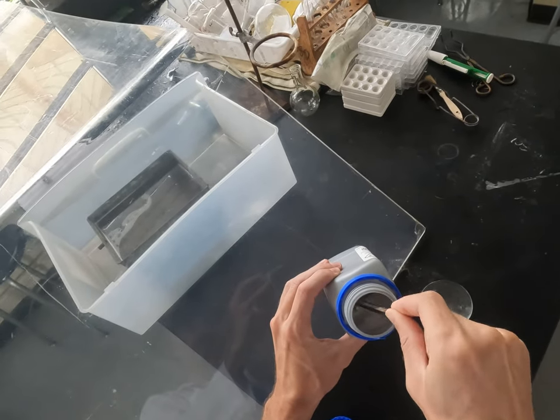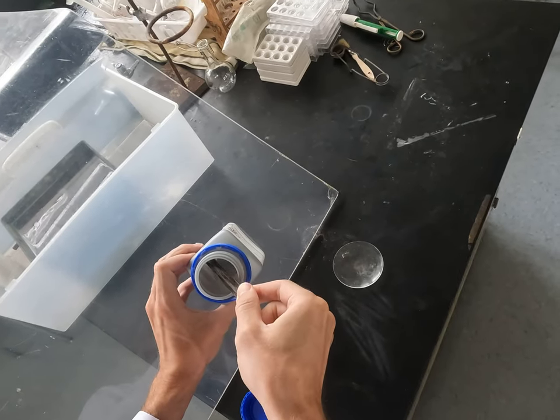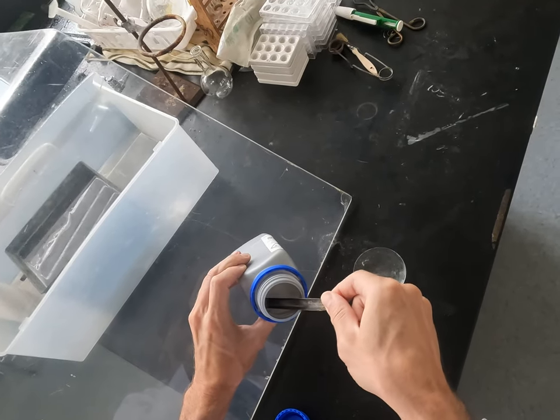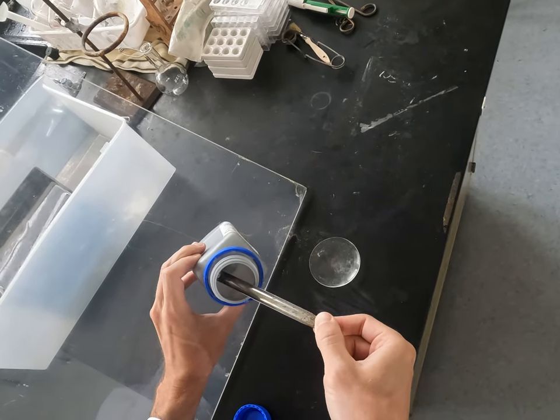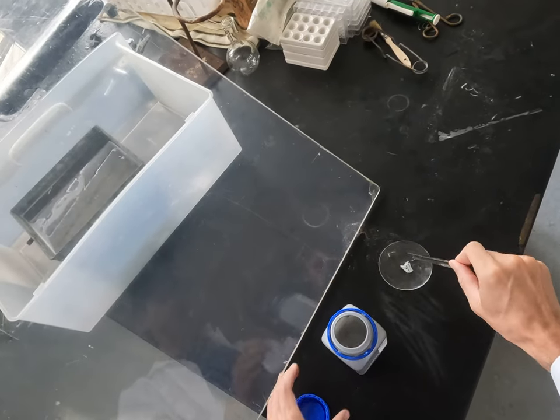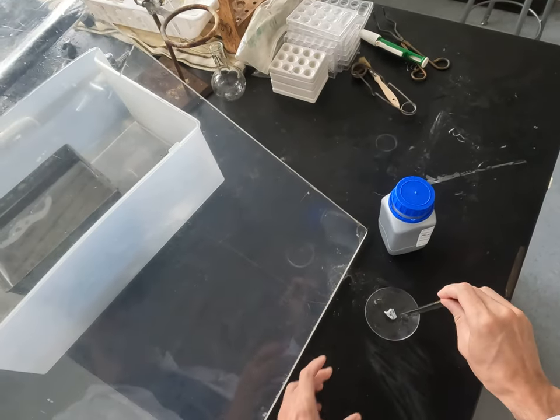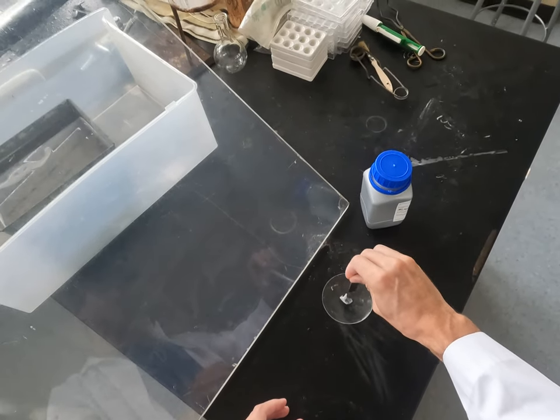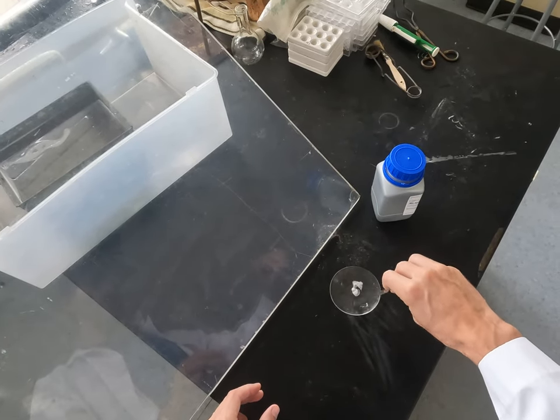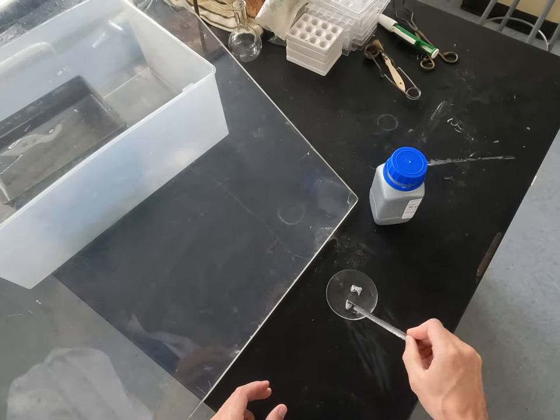Banana — banana's a good one, yes. Actually, bananas are high in potassium. So I need a pair of dry chopsticks. I have here a chunk of potassium metal, and it's soft enough that I can kind of push the spatula through the metal. It's a solid, but it's soft.